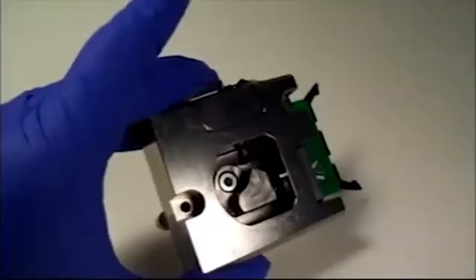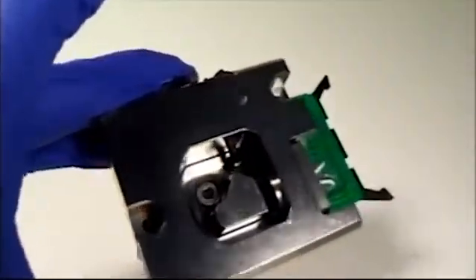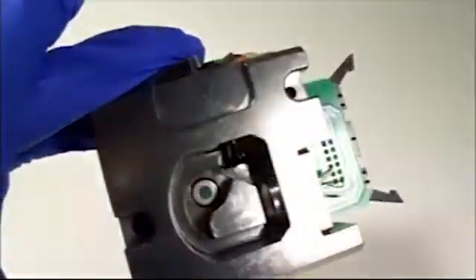Before you finish, visually inspect everything. It's usually easy to see spots or water drops that might be left on the surfaces. If you see any problems, just wash, rinse, and dry again with fresh kim wipes.